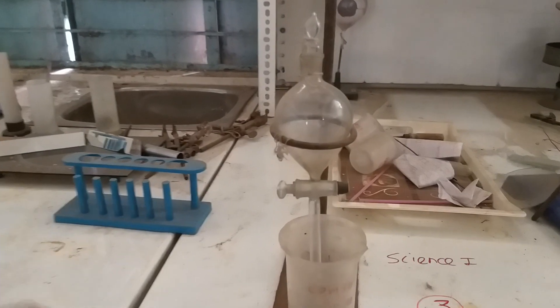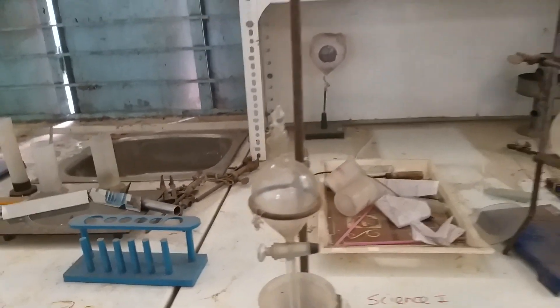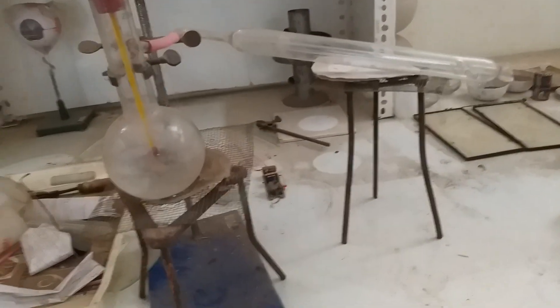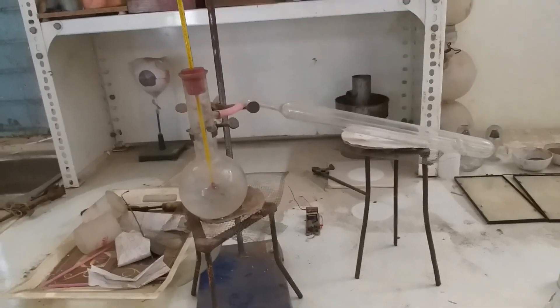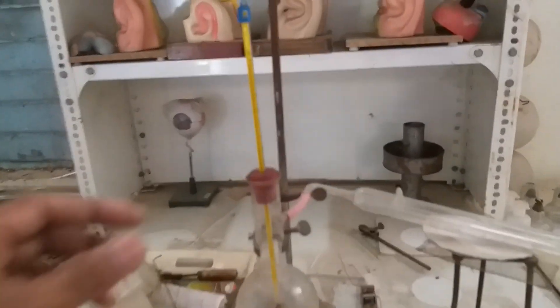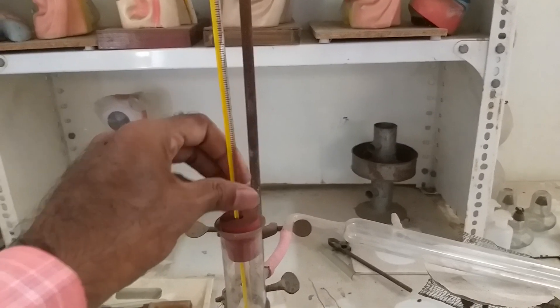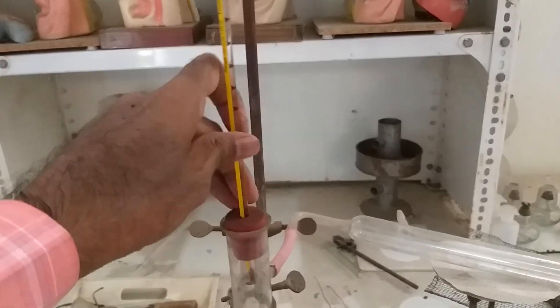The separating funnel is used to separate two immiscible liquids. This is the arrangement for the distillation process. This is the thermometer — see the mercury bulb here — and we can easily observe the temperature.